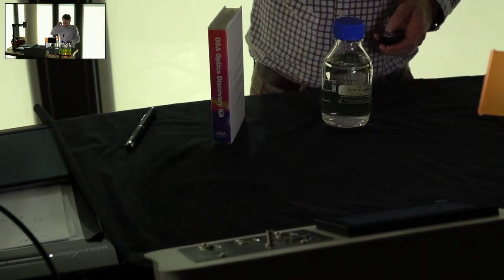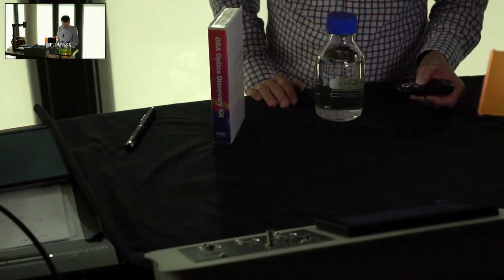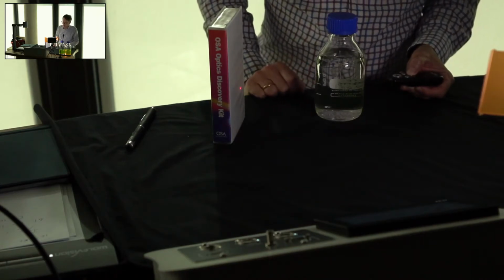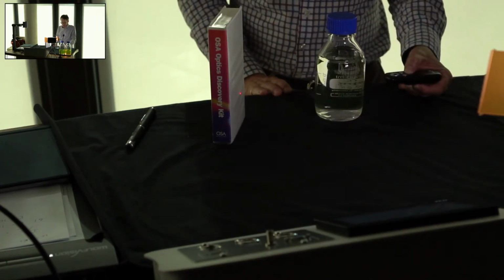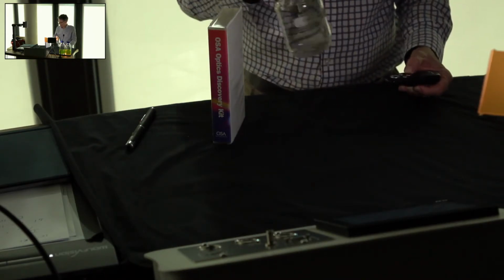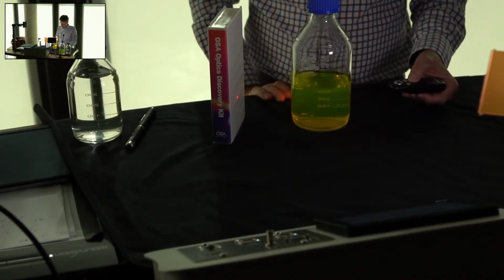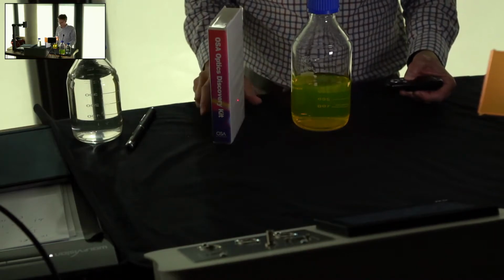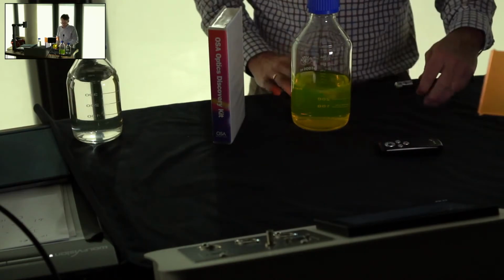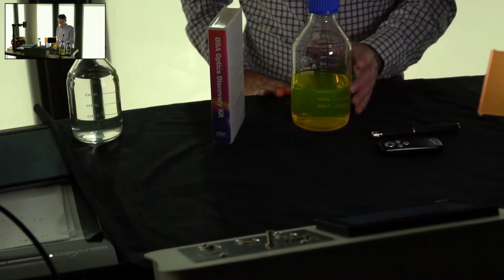Let me now turn to this laser. This is a red laser. And so if I pass this laser through here, nothing happens. The laser just goes straight through, and I don't see any fluorescence. Why is that? Tell me about why that may be the case. I can go back, in fact, to this highly concentrated sample. And look at this. Even in this super highly concentrated sample, this beam goes straight through. Whereas with the green beam, it was totally absorbed. It doesn't pass through. Why is that the case?